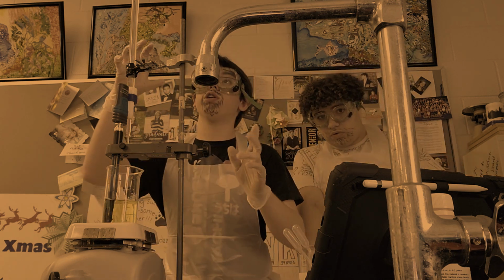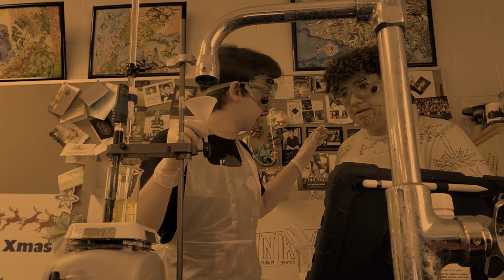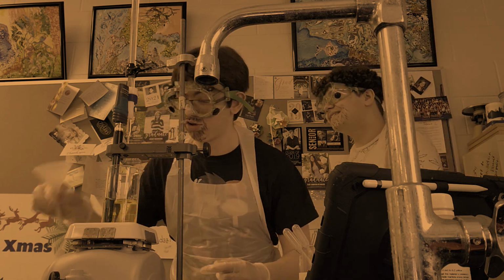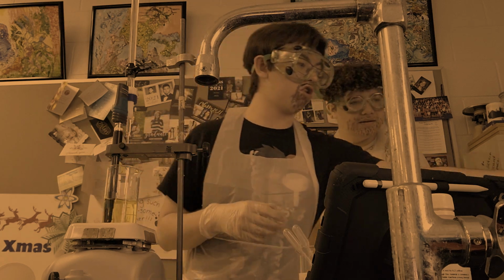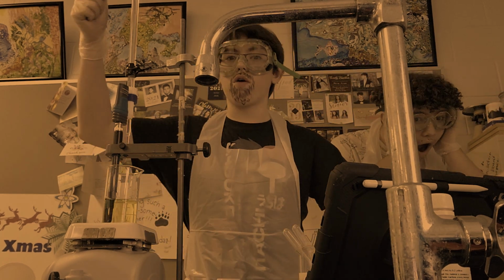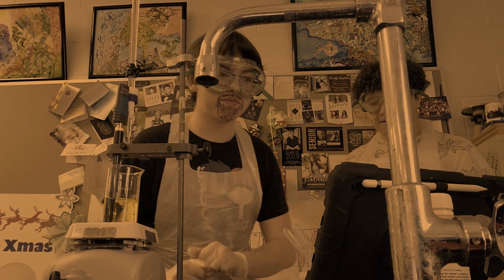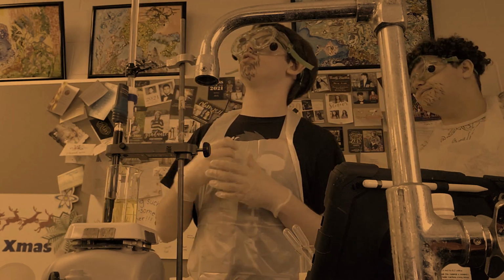And so, now, what we've got here is our procedure. So first, what we did was we used one of these bad boys. Y'all know what these are called, Jesse? Fennel. Real close, but they're called funnels. These funnels are what we use to measure our substances out in a graduated cylinder or the burette itself. Crazy, right, Jesse? You're blowing my mind. I know. I love science, so I know this stuff.